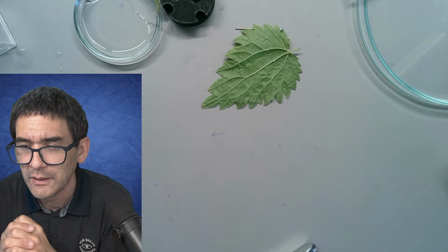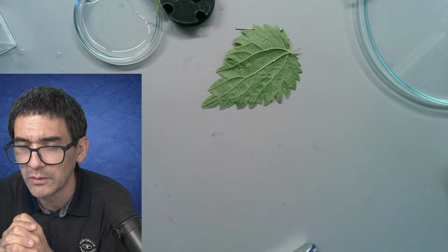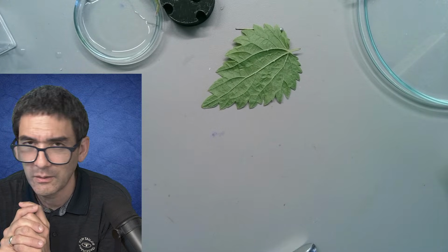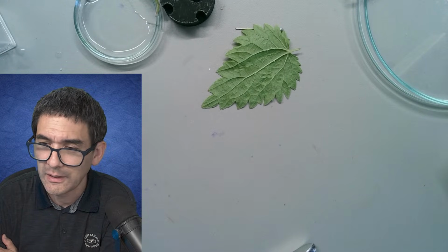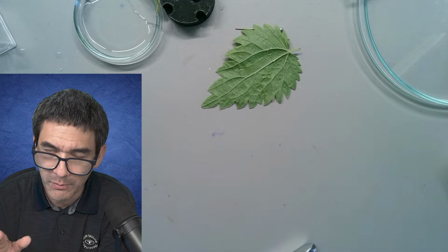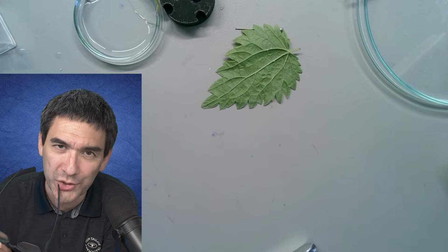How long can you keep a semi-permanent slide of onion plasmolysis? Honestly, if you want to keep slides for a longer time, you have to make sure that they're free of water. As soon as water is a little bit present, like semi-permanent, there is always the danger that it's going to start decomposing.